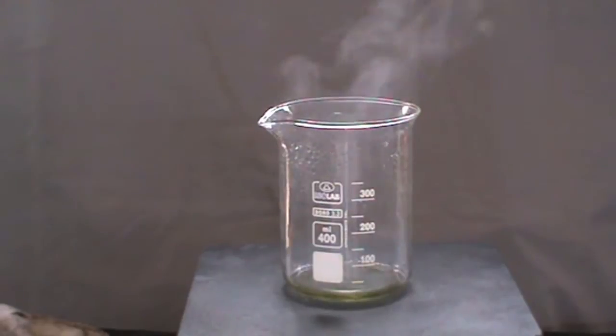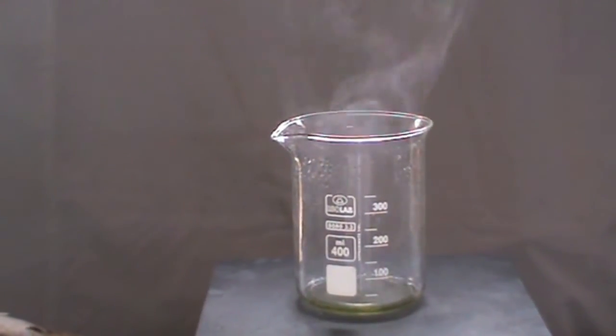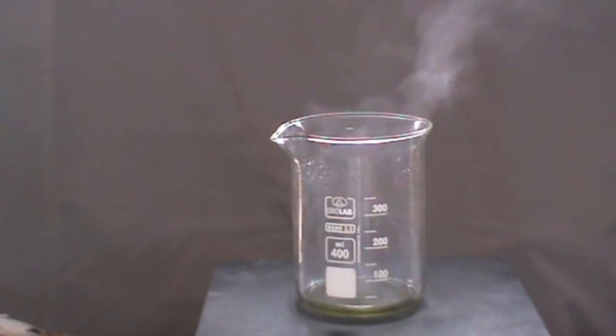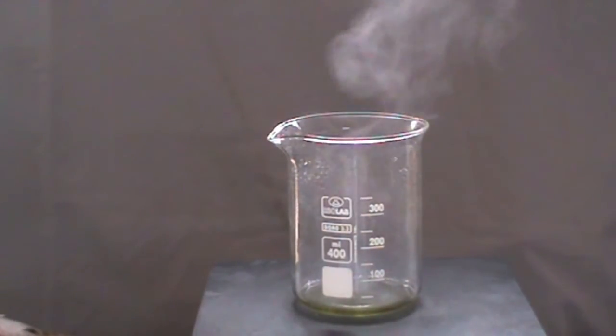As the water from the solution has evaporated off, we can see the formation of a dense white smoke. This is an indication that we have concentrated sulfuric acid.